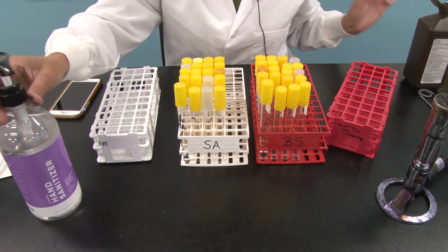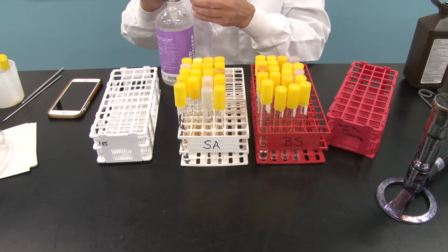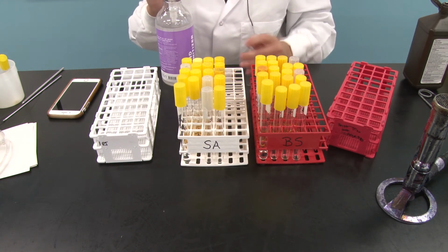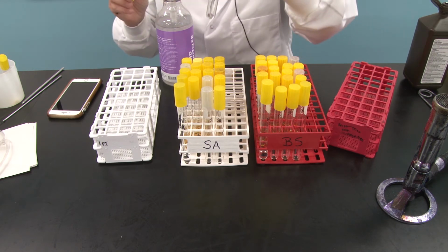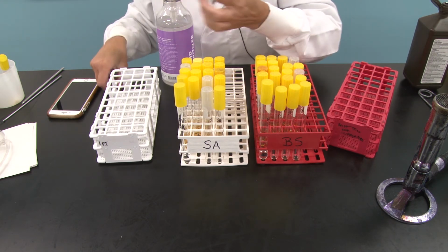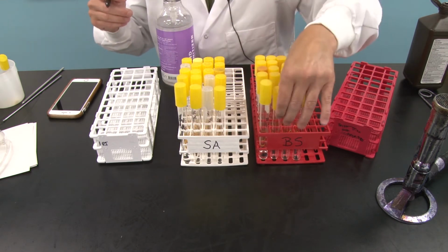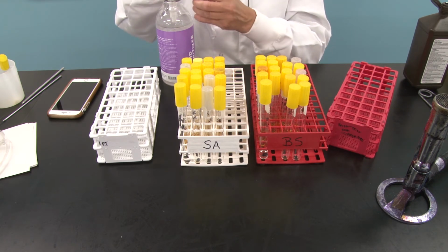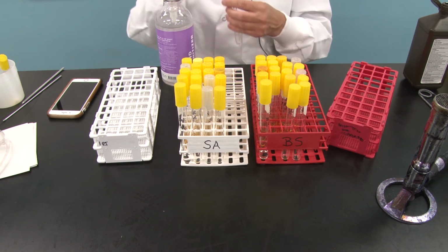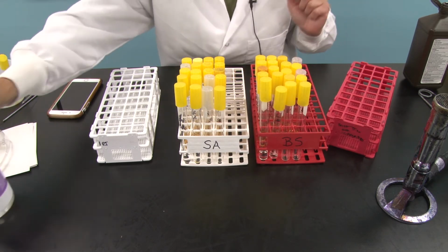Next, I'm going to take our hand sanitizer and squirt it in. It's a gel, so it's a bit of a problem getting that down to the bottom. I don't want to use too much of that because it is a gel. And I'm going to put hand sanitizer, or HS, under SA. Under BS here, I'll put HS again for hand sanitizer, and I will squirt that in. We'll let that settle to the bottom. We'll move that out of the way.